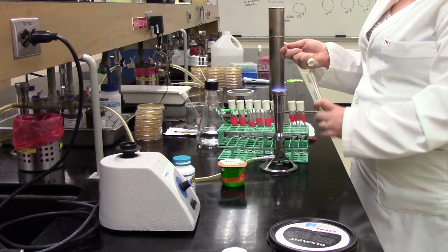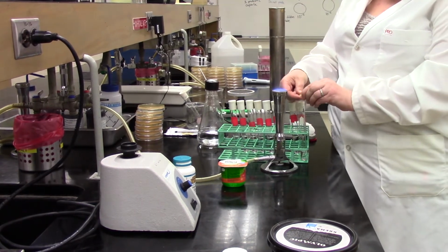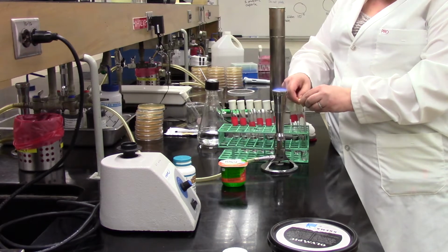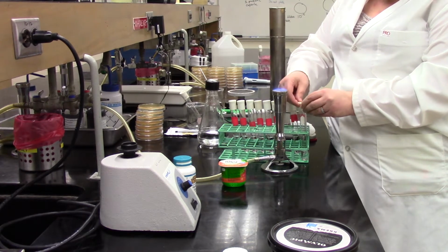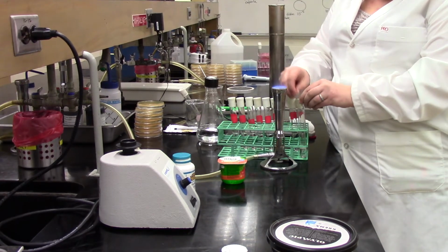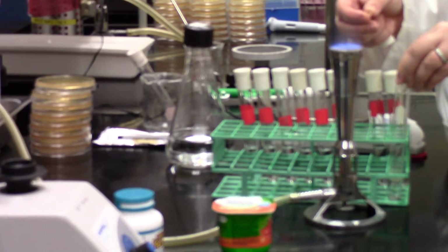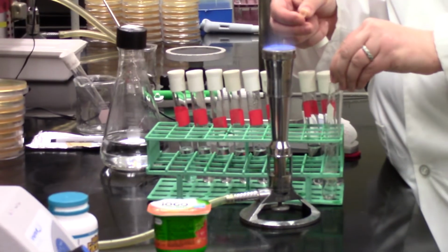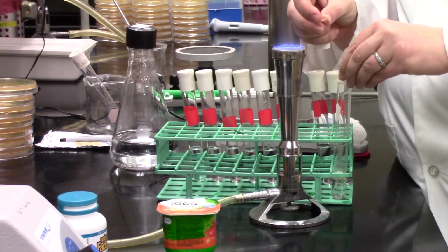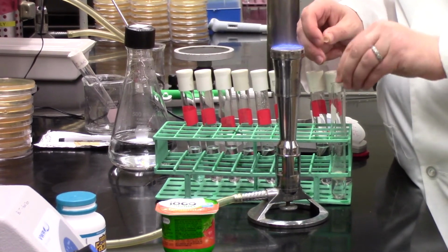Now she's just going to flame the neck of the top of that test tube, and she's going to break open that capsule right down the center. You should be able to just break it open. It's hard to see, I can zoom in a little bit, but you actually can see the powder from the inside of that capsule, which is all your desiccated bacterial culture sinking into that distilled water down there.